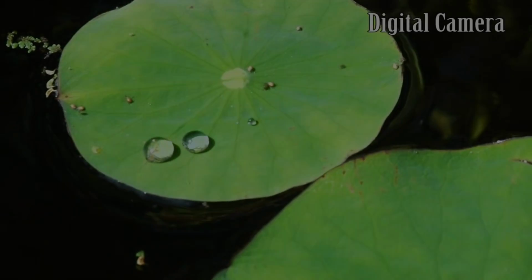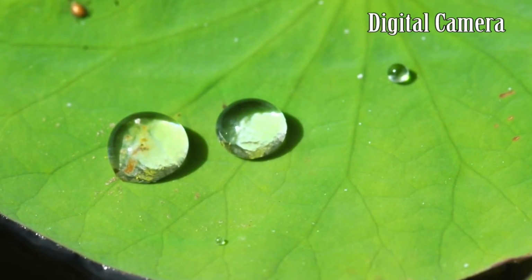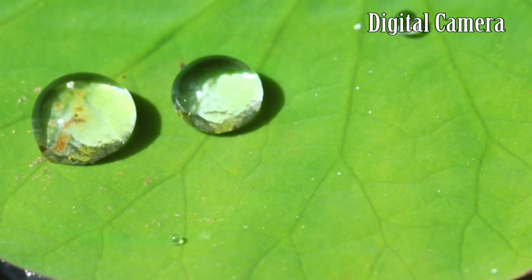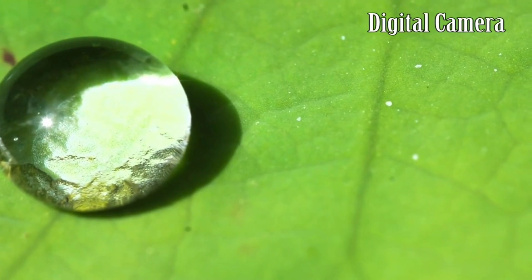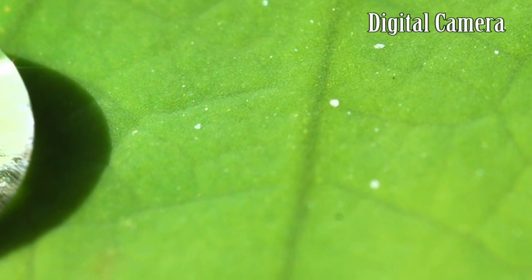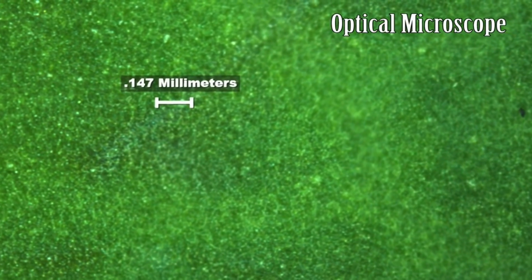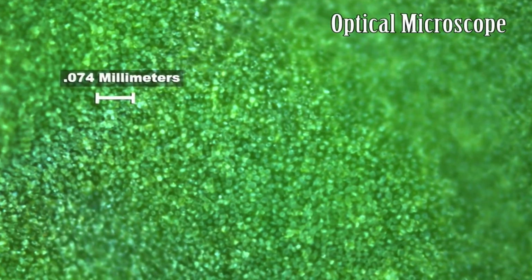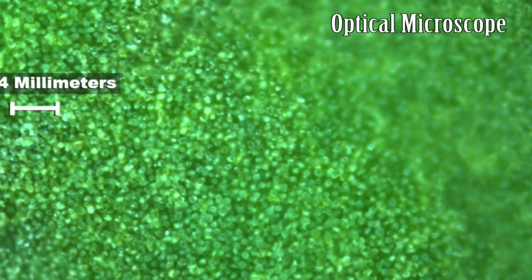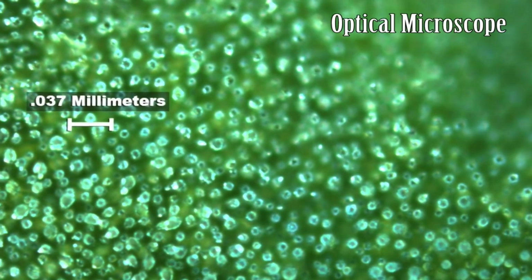For example, people observed the features in our world around us, like this lotus leaf. Everybody knows that a lotus leaf does not get wet. And many people suggested maybe there's special chemistry on its surface or oils. Actually not. It's just a topographic feature of its leaf, similar to a velvet cloth, which doesn't get wet easily. It has a number of very, very fine hairs. And when you zoom in, they're not even of the size of millimeters or sub-millimeters. They're of the size of a micron and less.